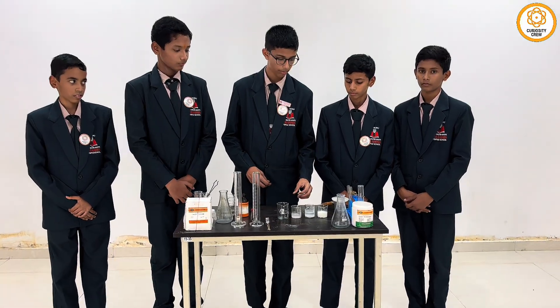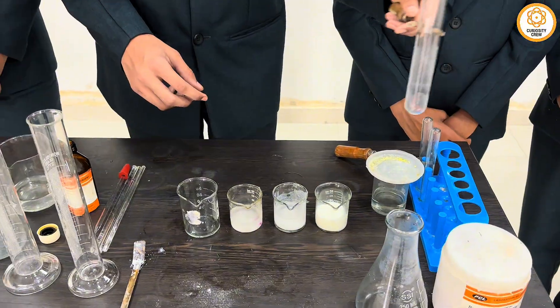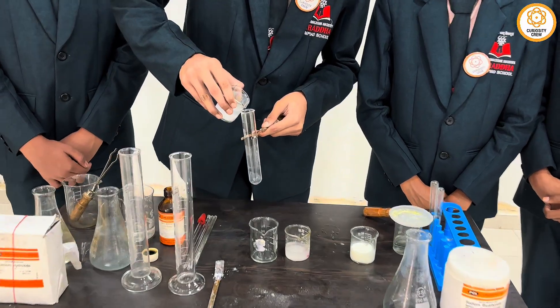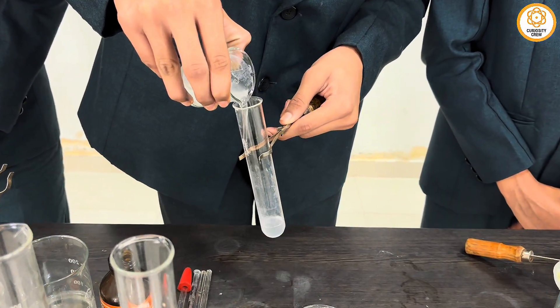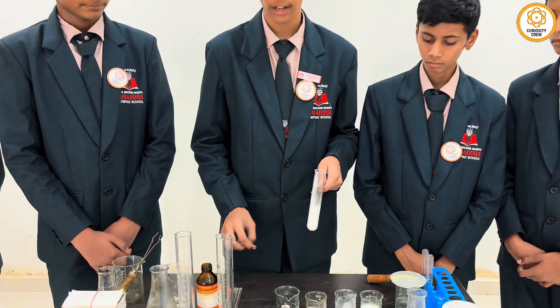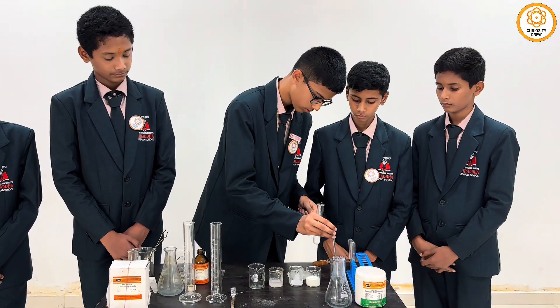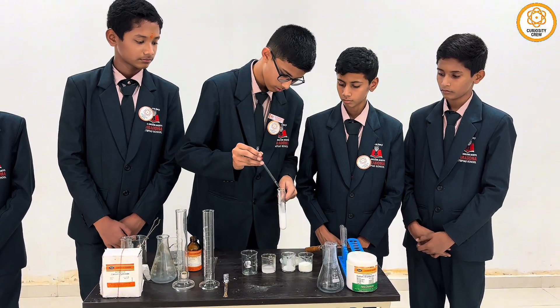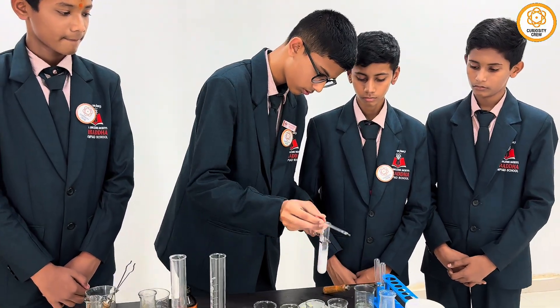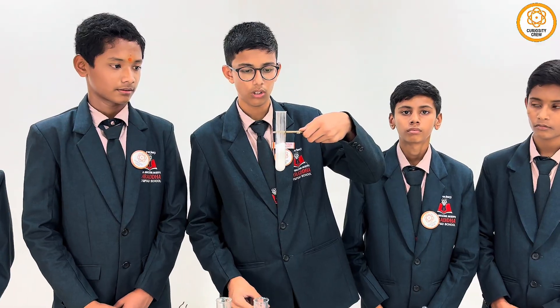First of all, we will make calcium chloride solution. To make it, we will take a beaker and add calcium hydroxide solution in hydrochloric acid. Now we will add hydrochloric acid into it. The solution formed is calcium chloride. So we get calcium chloride.